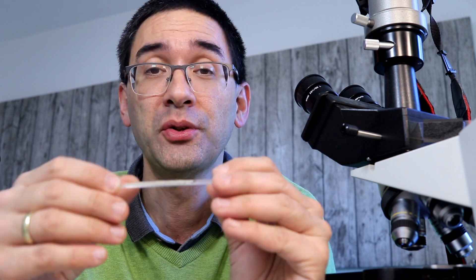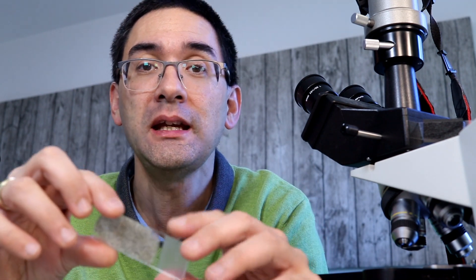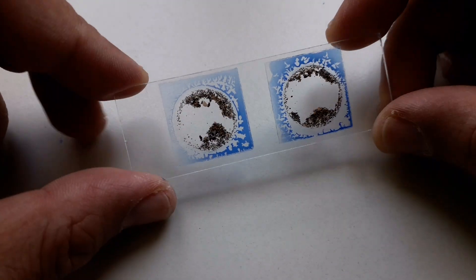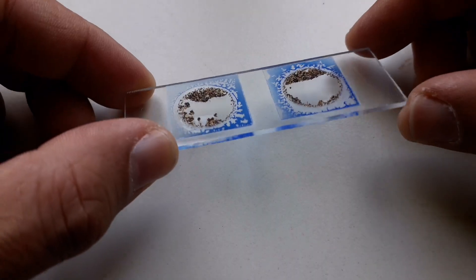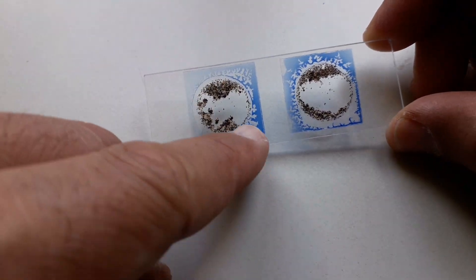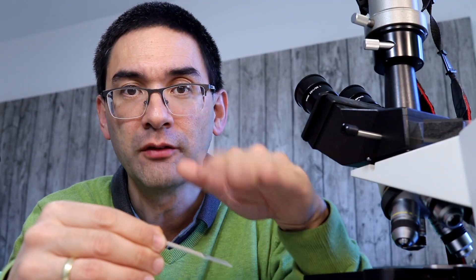So I said that's actually quite a good idea to try mounting sand, because some time ago I already made a video on mounting sand but I used so-called concave slides. Now these are slides with an indentation. The slides are a little bit thicker but they have an indentation, so I basically put the sand into this indentation and a cover glass on top.